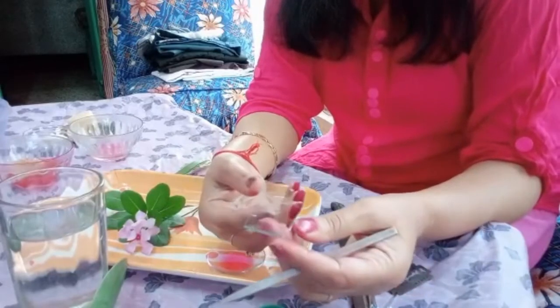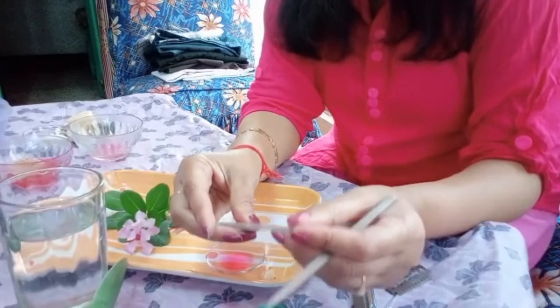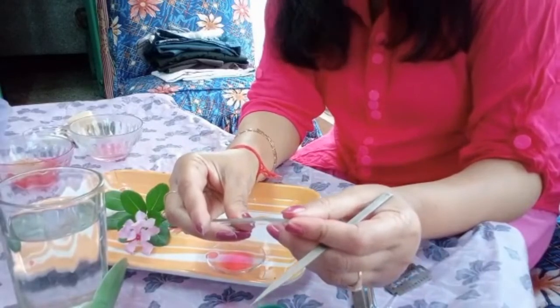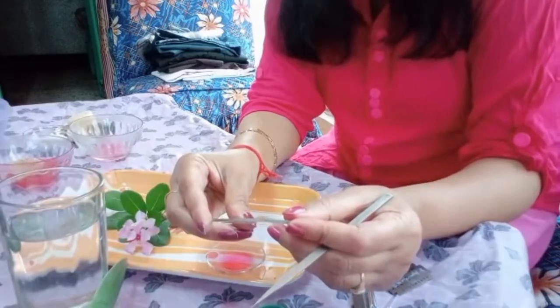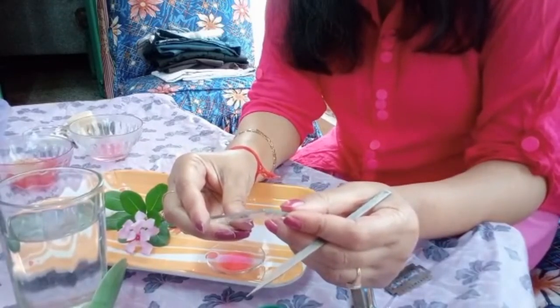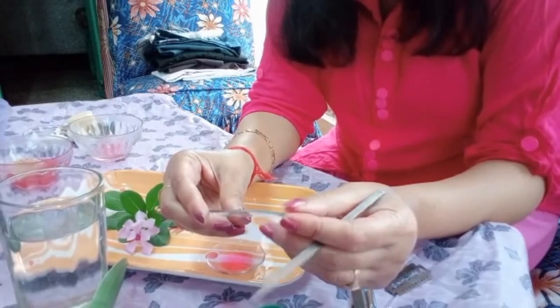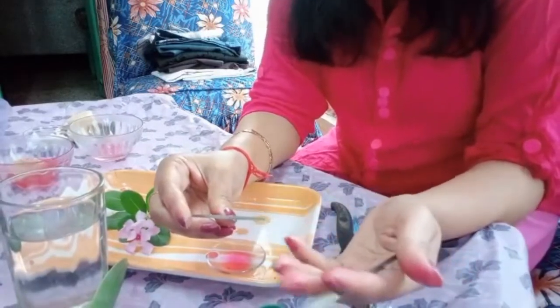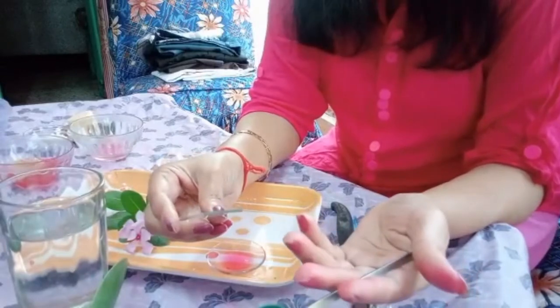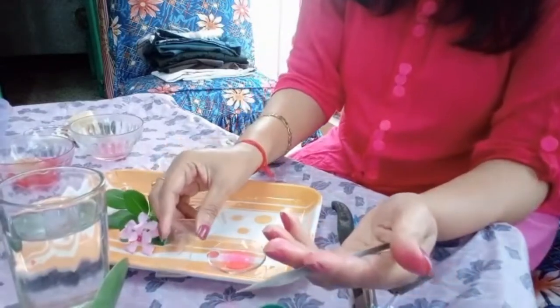After this it has to be placed under the microscope to see the distribution of stomata. As I have taken the lower surface, naturally I'll be able to see the presence of stomata on the undersurface or the lower surface of the leaf. I have used a monocot leaf, that's why equal distribution is expected, whether I am taking the upper or the lower surface of the leaf.